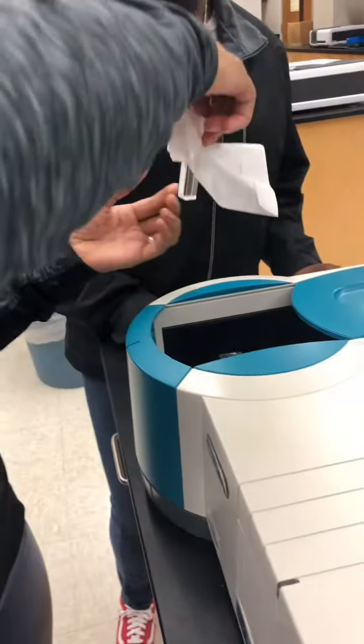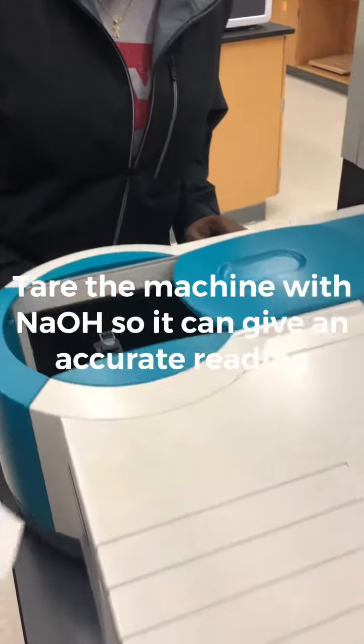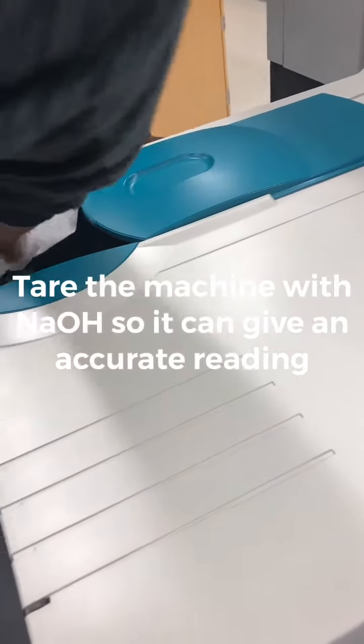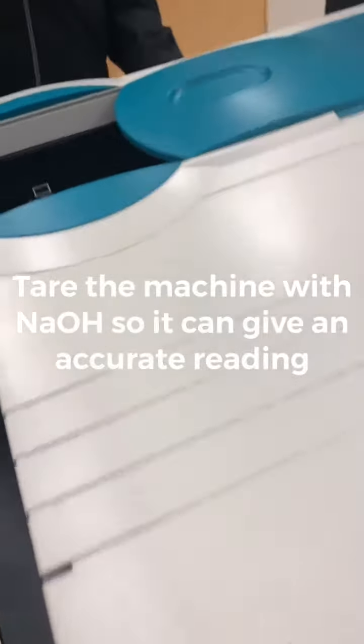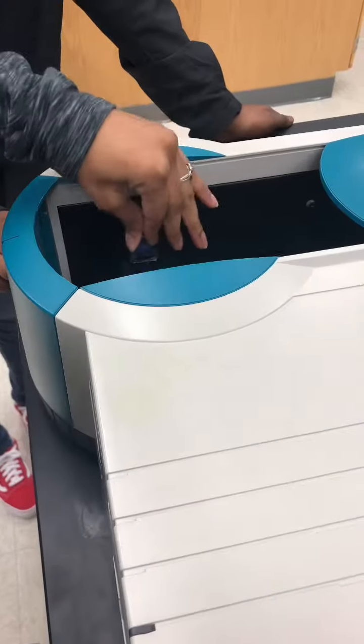We cleaned the cuvettes before inserting them into the spectrophotometer, so the sides that are exposed won't have anything blocking or interfering with the absorbance. Here we are wiping the cuvette again for our stock solution and inserting it into the spectrophotometer.